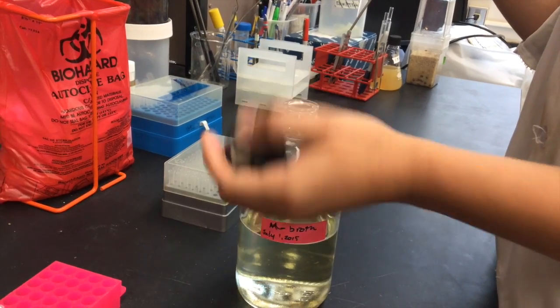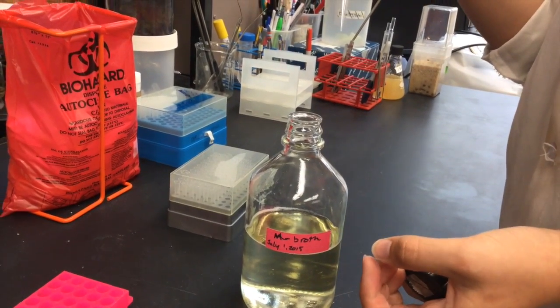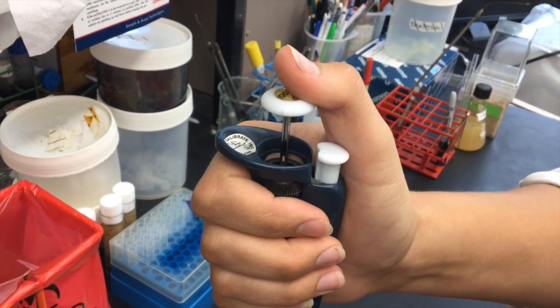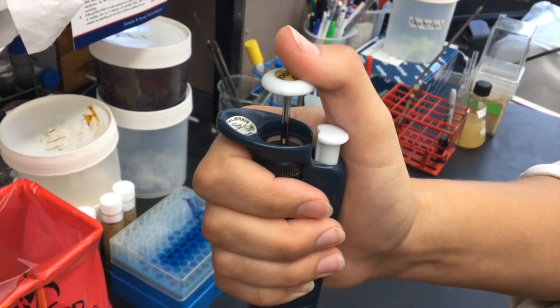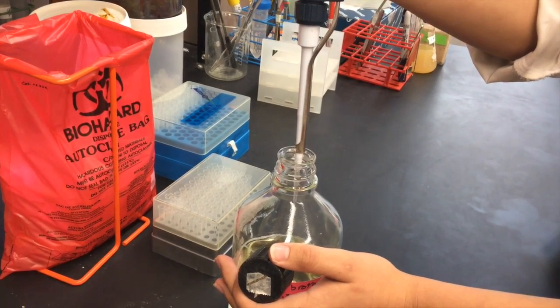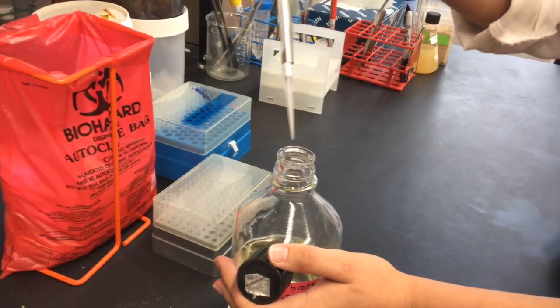We are ready to expel the liquid. Discharge the solution into the appropriate container by depressing the plunger to the second stop point. We always look at the tip to make sure that the liquid has been expelled.